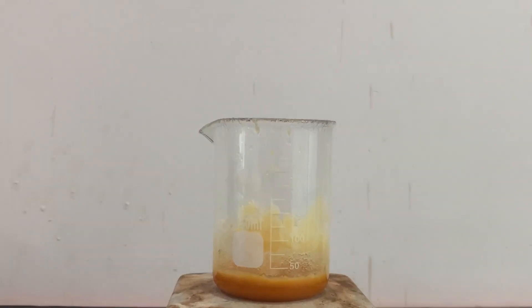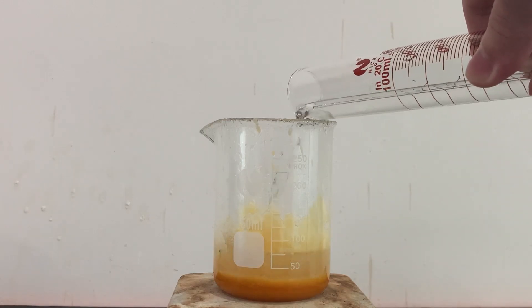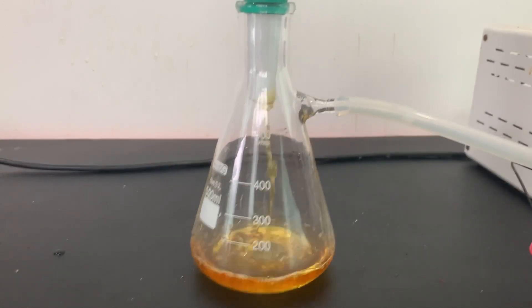After heating the reaction mixture, I let it cool back down to room temperature. I then added 80 milliliters of water, which serves to wash our product as it is insoluble in water. The mixture is then vacuum filtered.